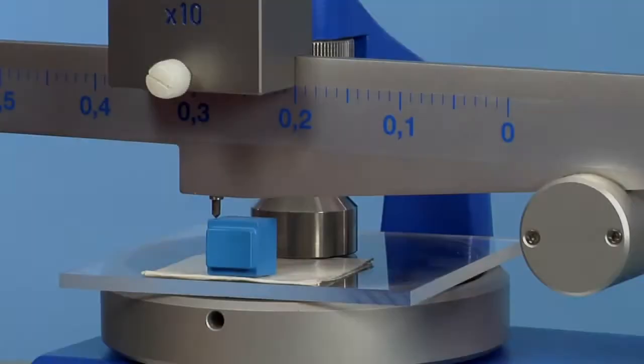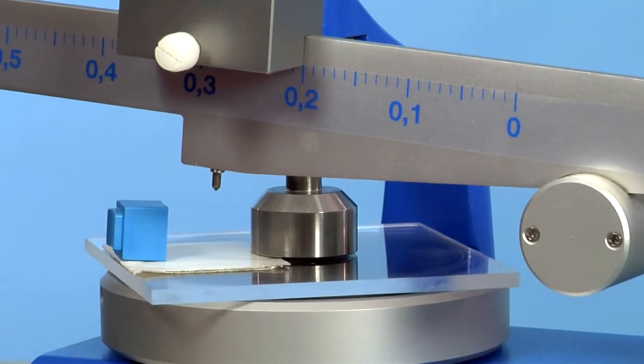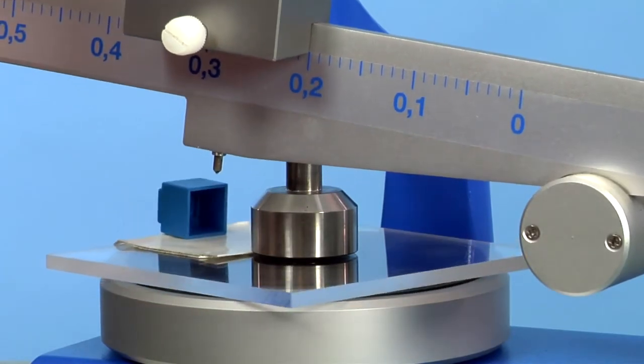And so on until there's no longer any trace visible. Quick and convenient.